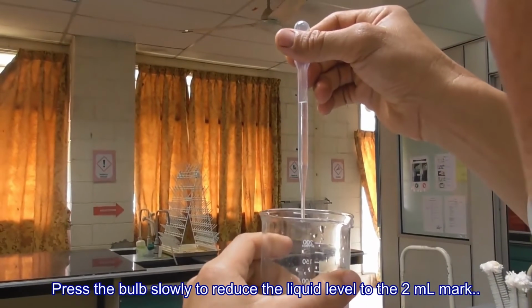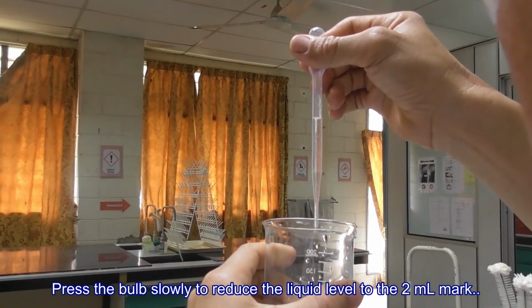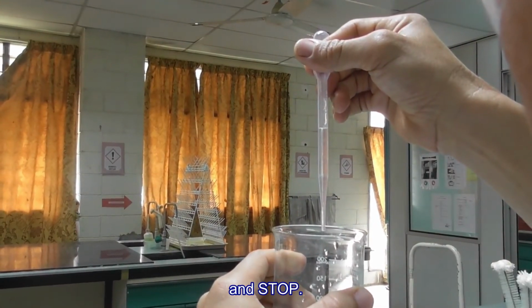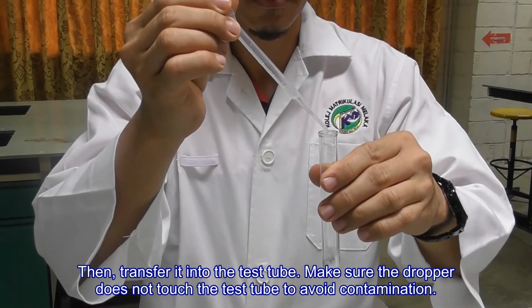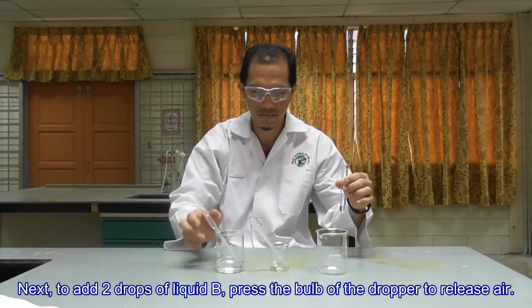Press the bulb slowly to reduce the liquid level to the 2 ml mark. And stop. Then, transfer it into the test tube. Make sure the dropper does not touch the test tube to avoid contamination.